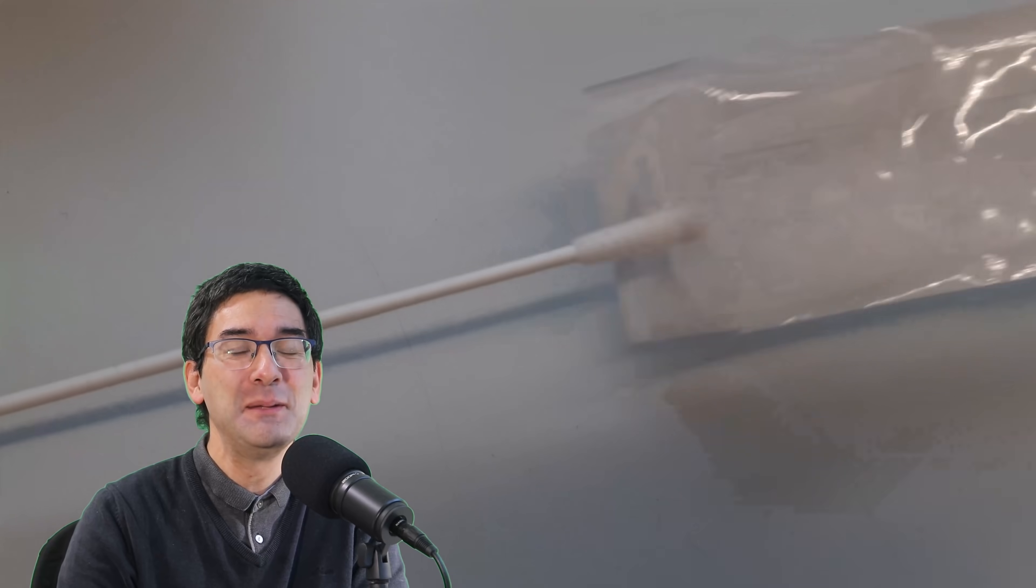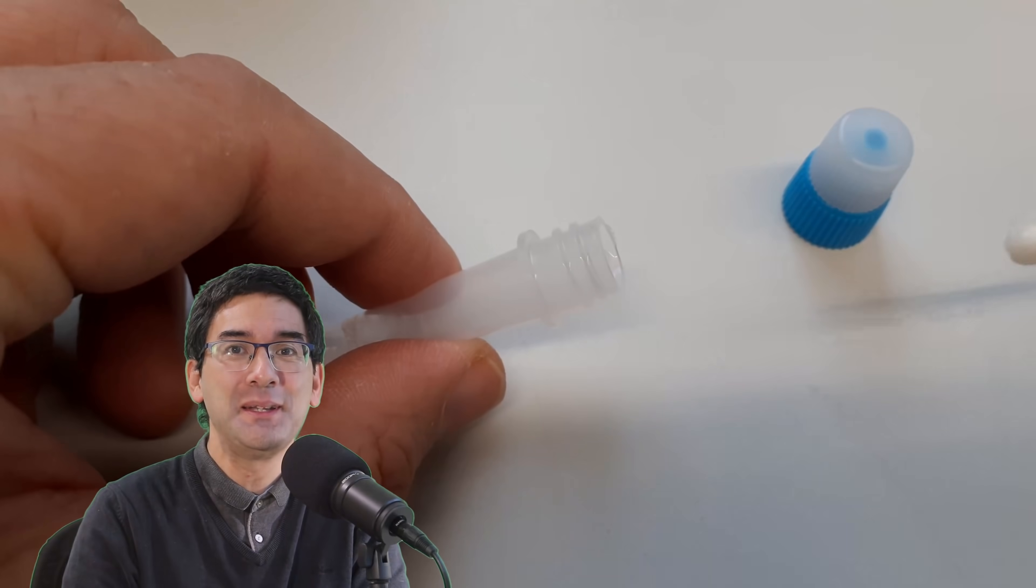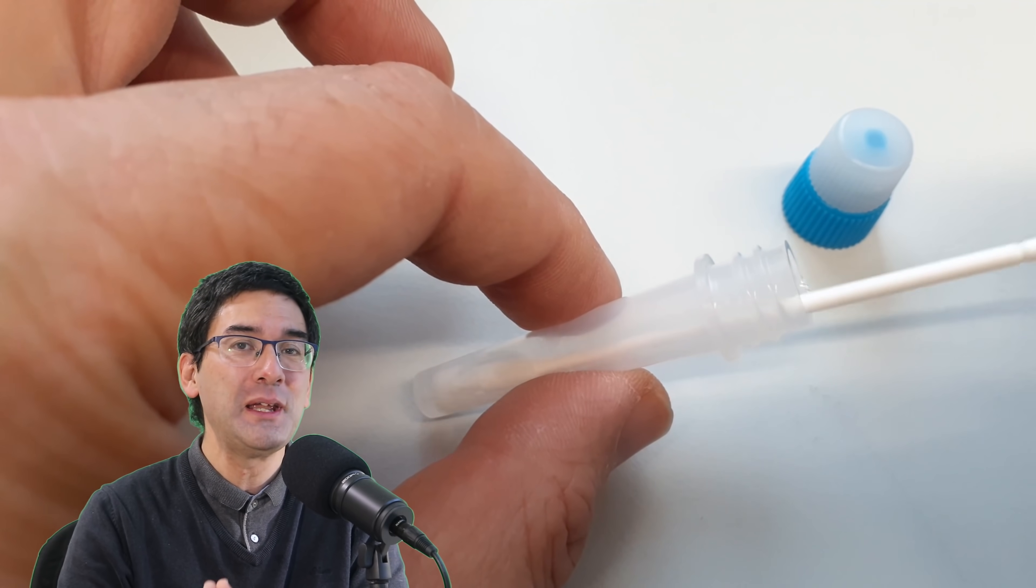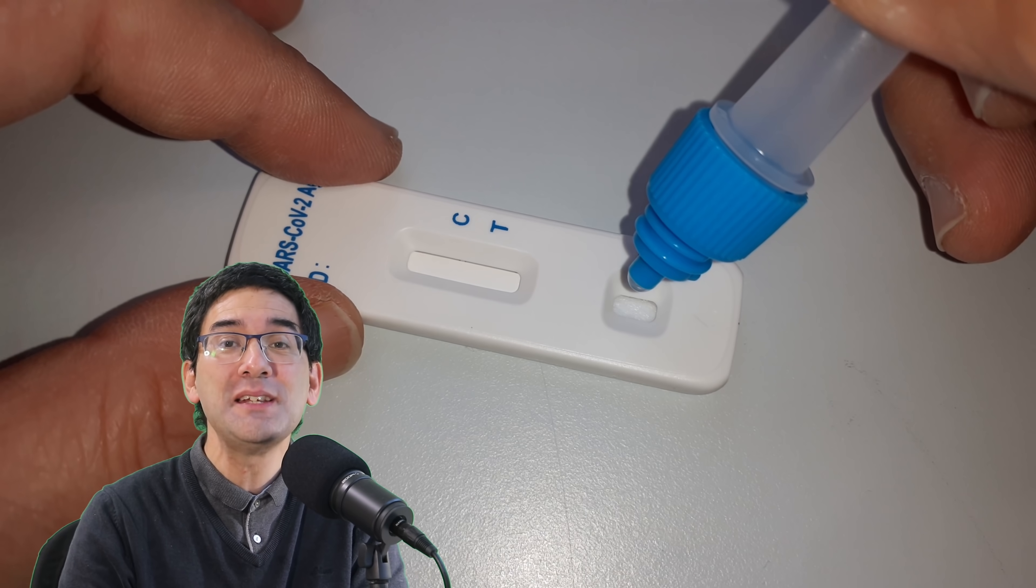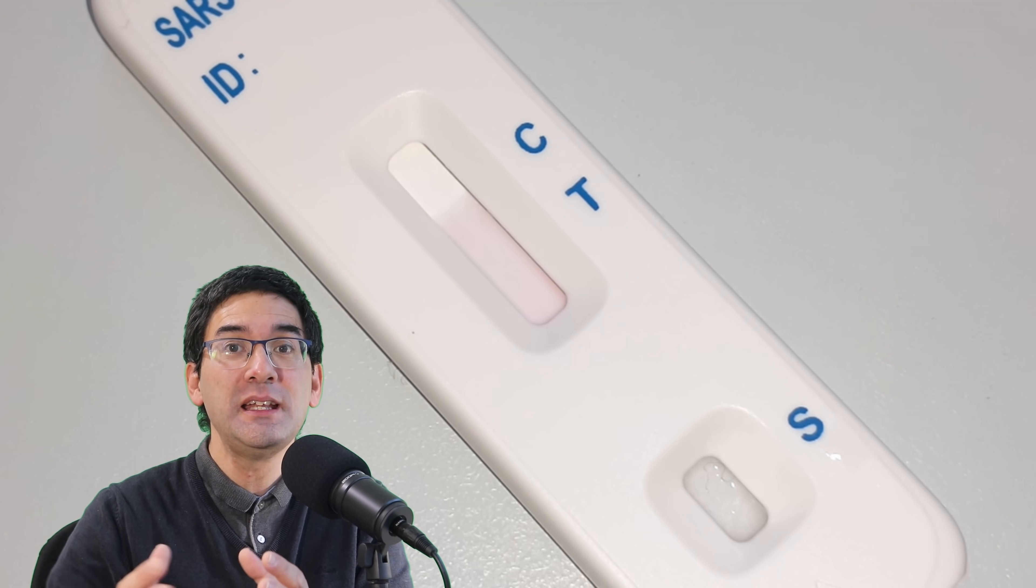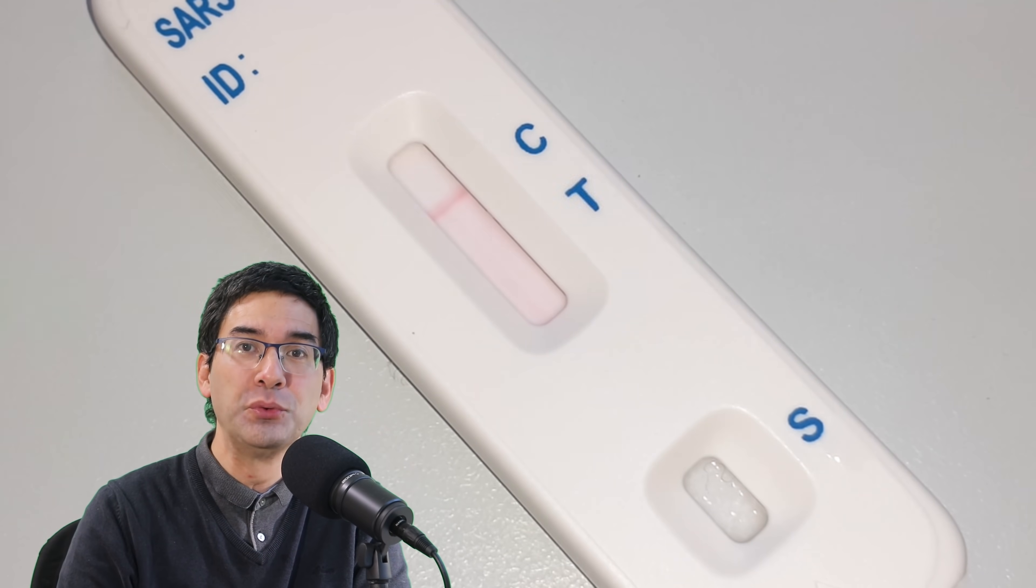What happens when you suspend them in the solution, the so-called lysis buffer? Many of you have already done this rapid test. You take a sample from your nose which might contain coronavirus and suspend it in this liquid. This liquid is a detergent that works like soap - it breaks up the virus particles and releases the virus proteins.